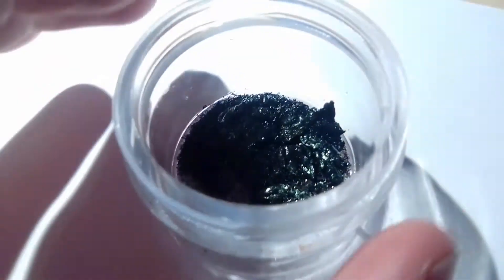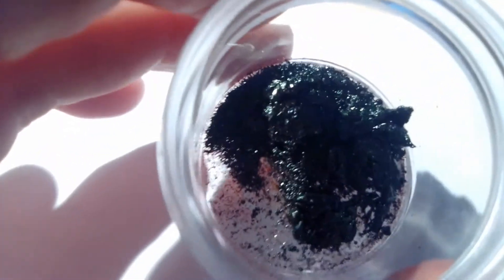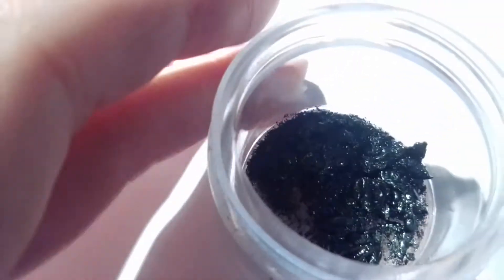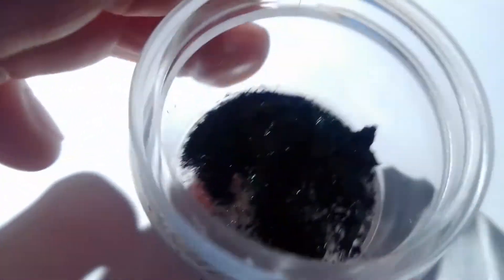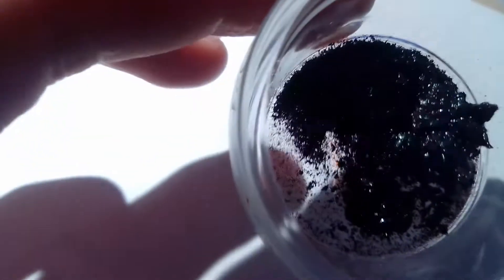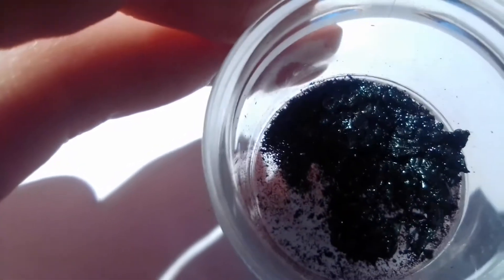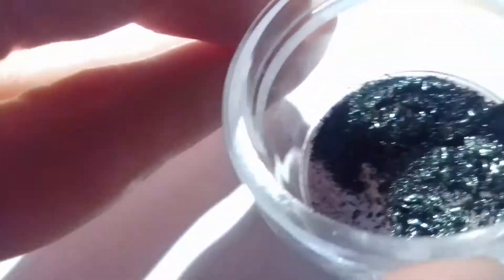After adding the water, I just filtered, well I didn't filter, I just decanted the water from the top because the aurin sat on the bottom as a tarry mass. I collected it, dissolved it in some more ethanol and dried it on a plate.